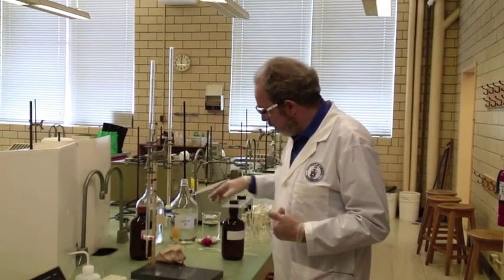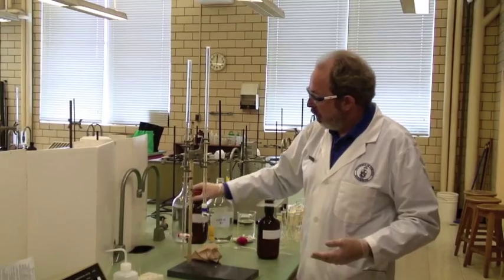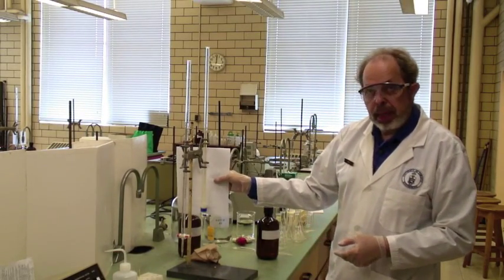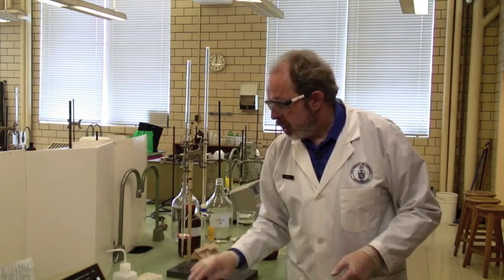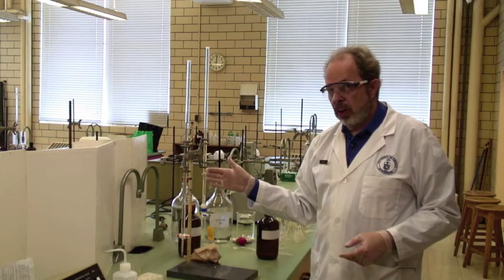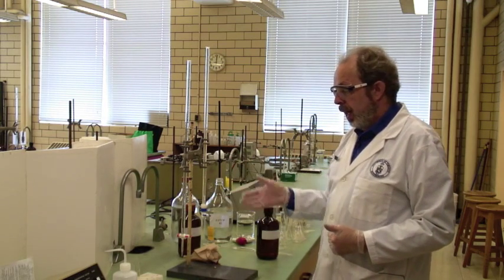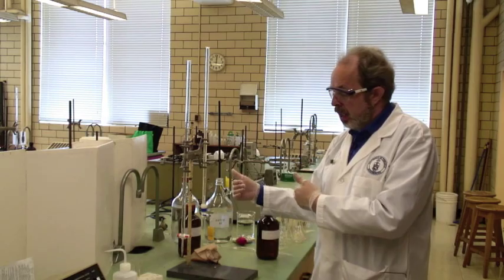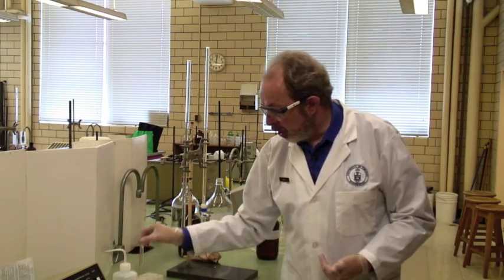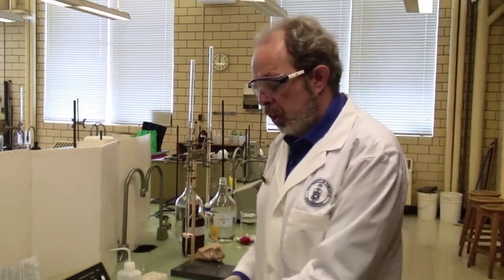To do that, we have a stock solution of iodine here. As you can see, if I put something white behind it, it's slightly yellow colored. You will take various volumes of the iodine solution and add potassium nitrate and KI to it, and you will get more and more dilute solutions. I've got one of them ready to go here. Let's start up the spectrophotometer.